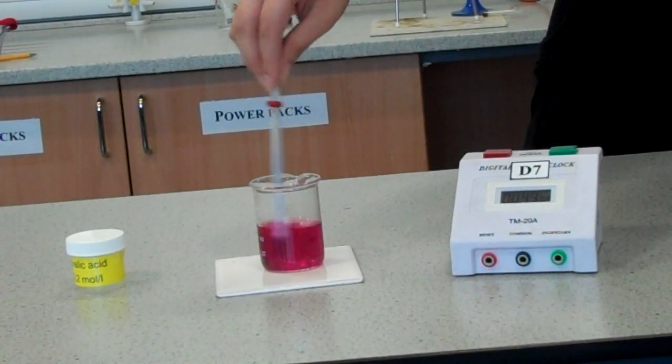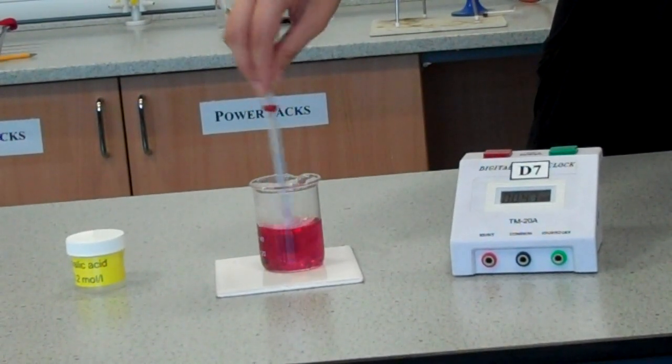The experiment is finished when the solution changes from clear purple to colourless and then we stop the timer.